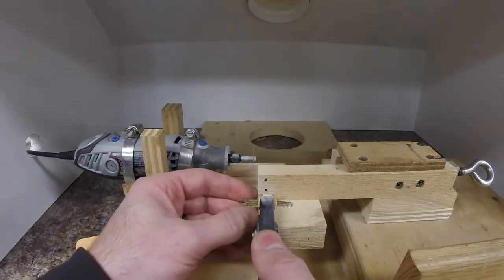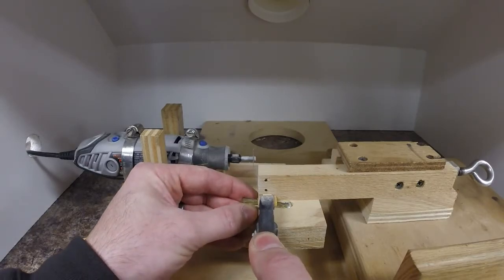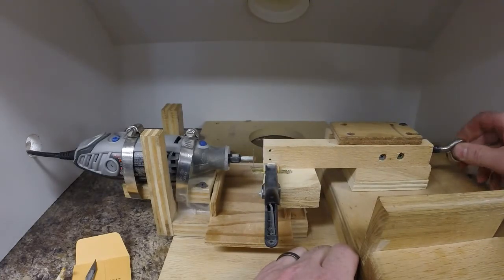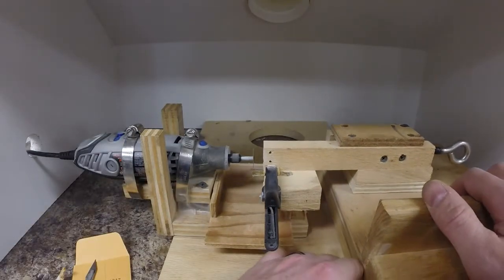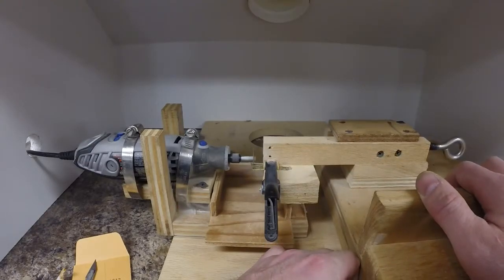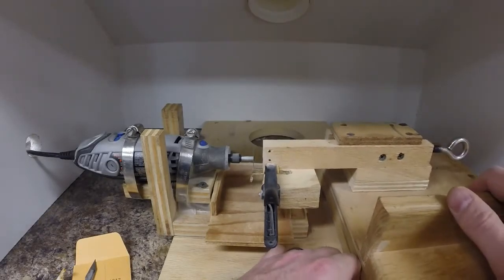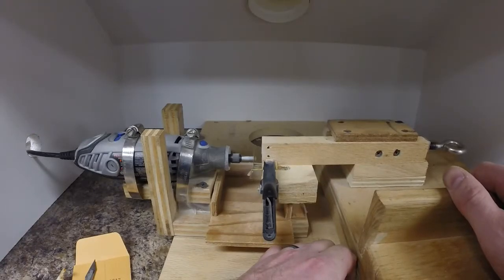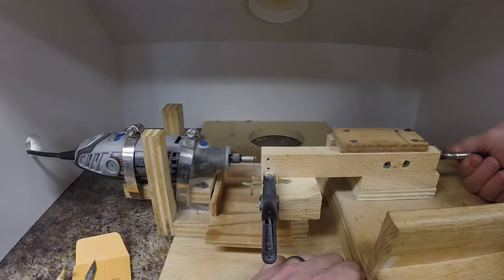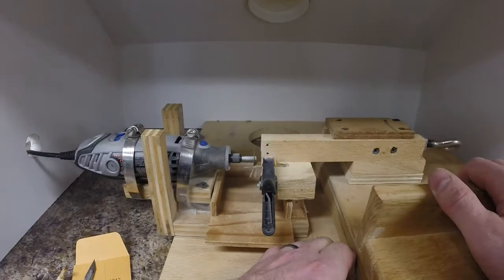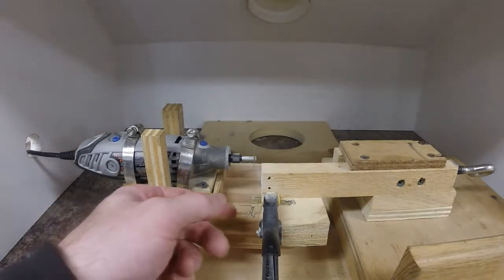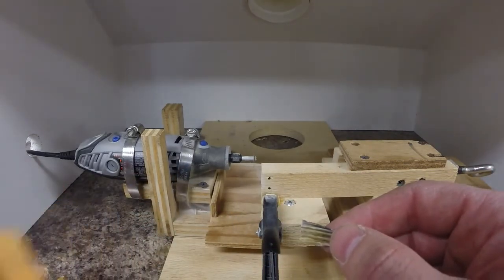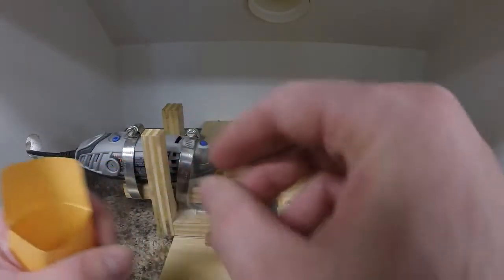I'll clamp it in so the rays are perpendicular to the blade, set up for the first cut. These ones will often stick together right at the end, which is fine. You just pop them off after they're cut. Also, like the maxilla, I save the rest of the structure just in case I need to take another cut later.